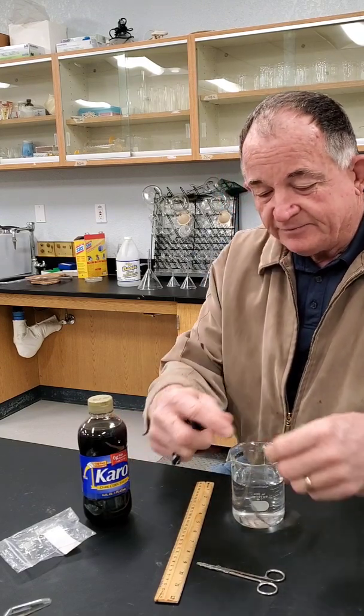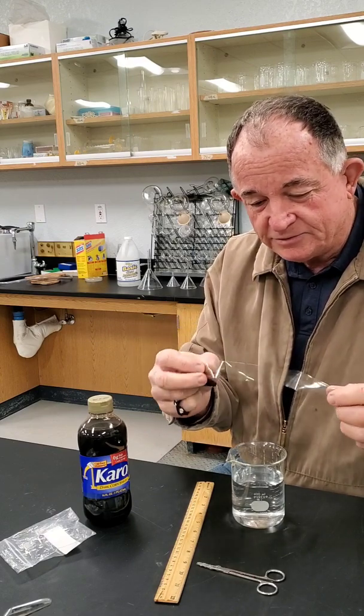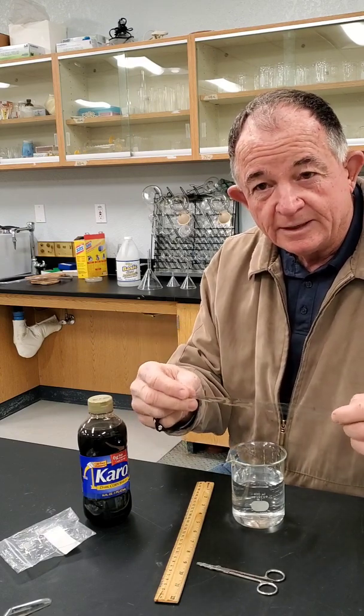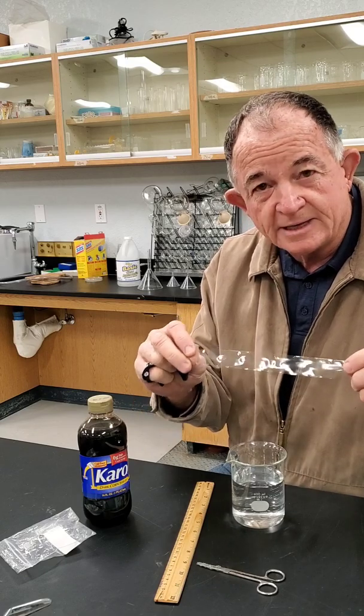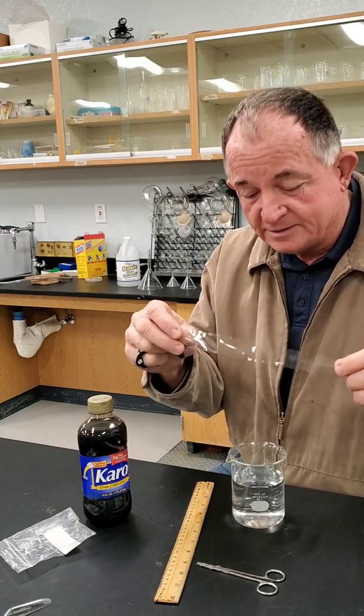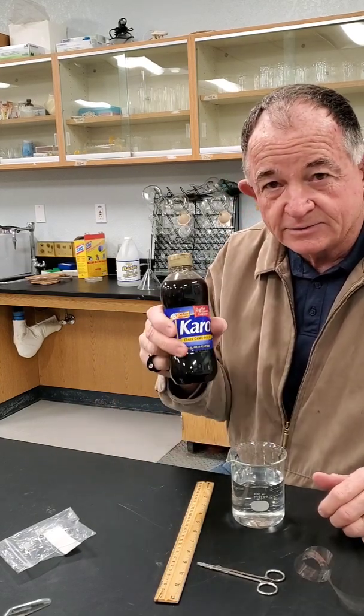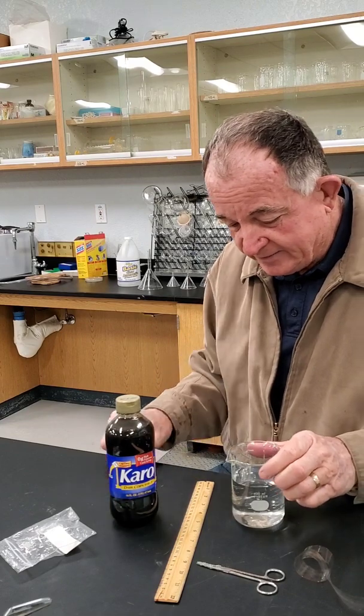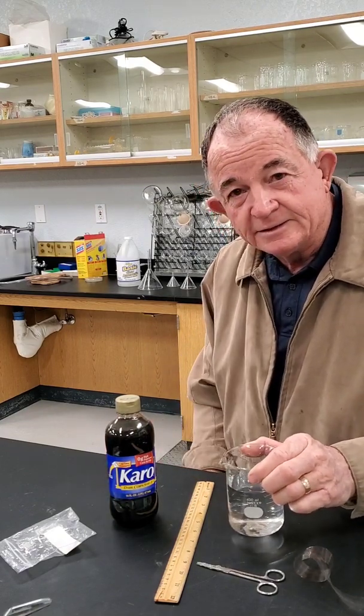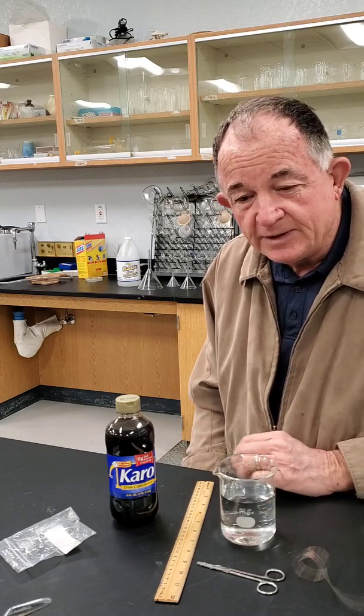We have a little bit of dialysis tubing here. It's the same tubing that you use for the treatment of kidney problems. It's called dialysis tubing. You might know someone that has to be on dialysis for health problems. We have some good old Karo syrup and we have a beaker here of distilled water.